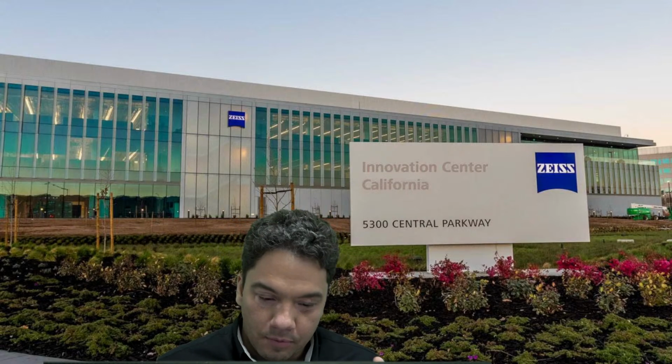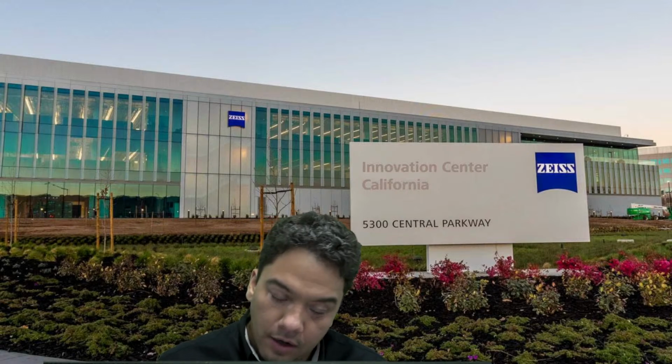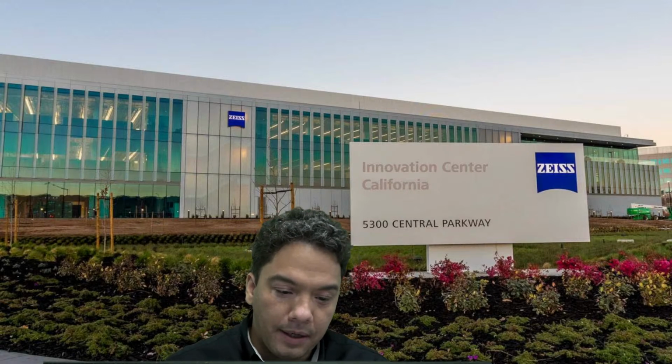Today we are going to experience TEM-like precision. Remember, if you have any question during this session, please input it in the live chat, and at the end of the session, I will be happy to answer your question.